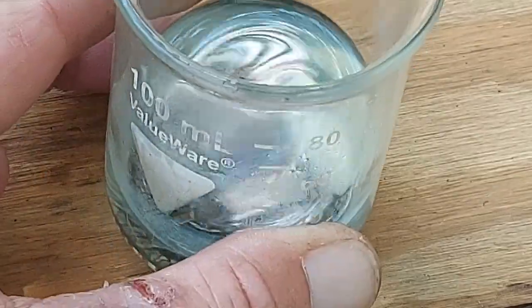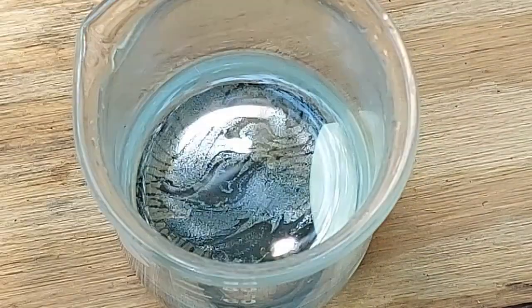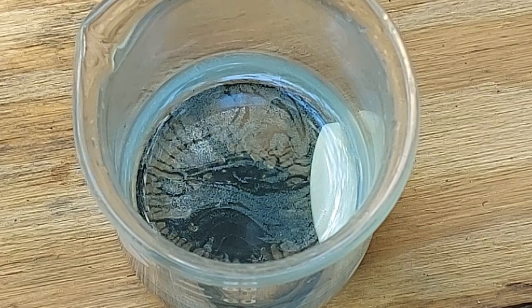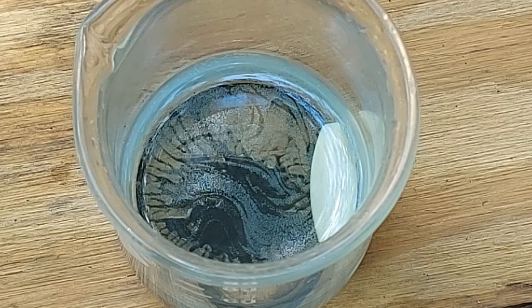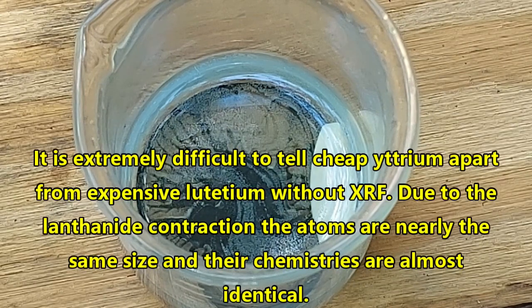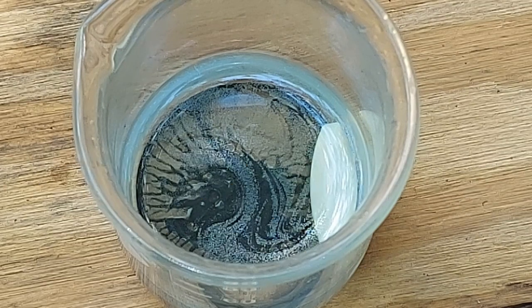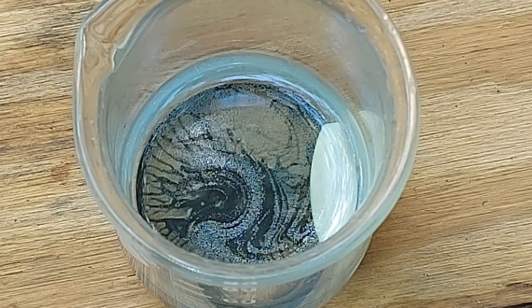And the color is a little odd. Now, I can't say anything definitive about that. The solution kind of has a bit of a yellowish tinge. But the HCl is in excess, so we can't really say anything too conclusively from that. Although if it was samarium, I know that has a much stronger yellowish color. But something else like yttrium, gadolinium, I think terbium, ytterbium, would all produce a solution that would more or less look like this. I mean, it could be anything. If I can't trust the purity, then how can I trust the identity of this stuff, right?